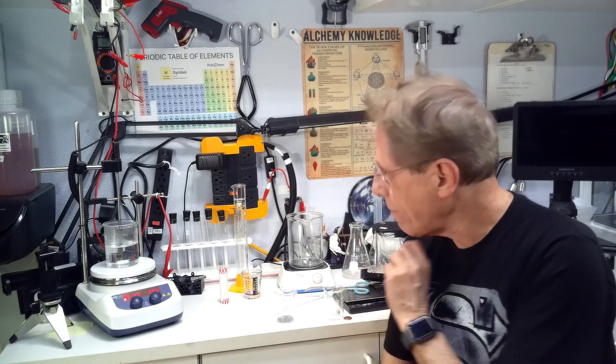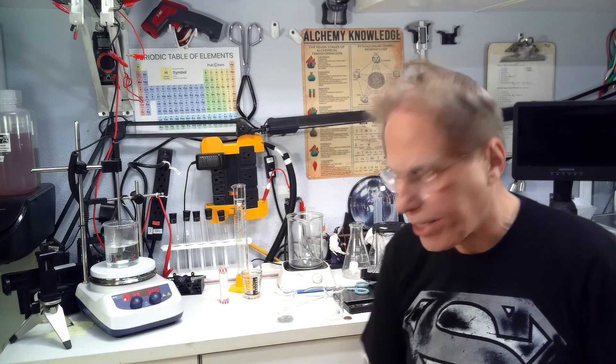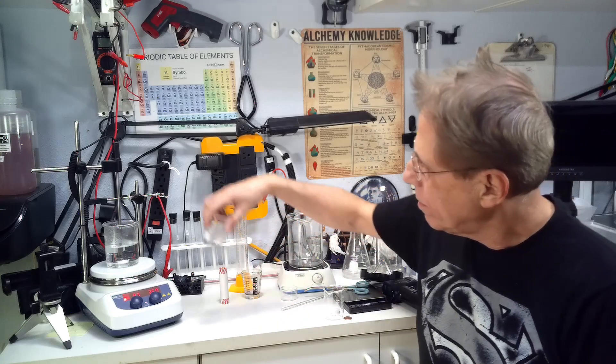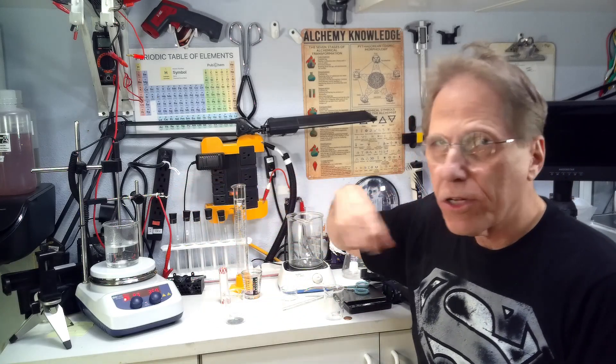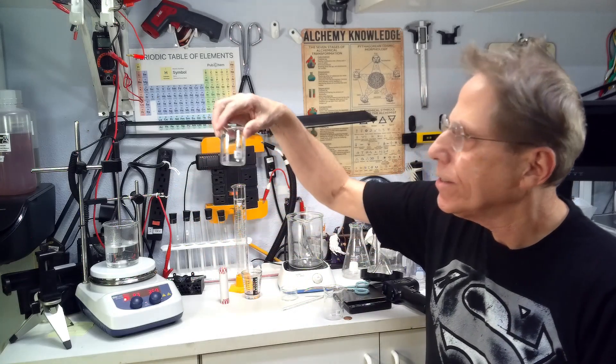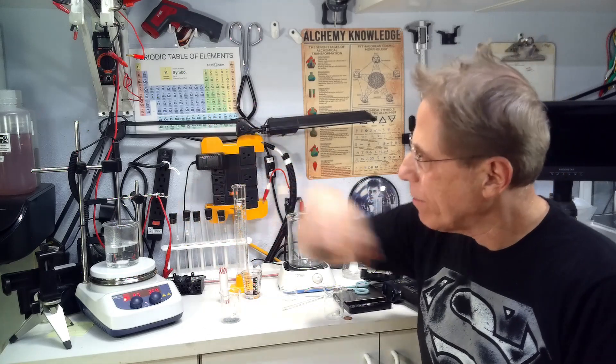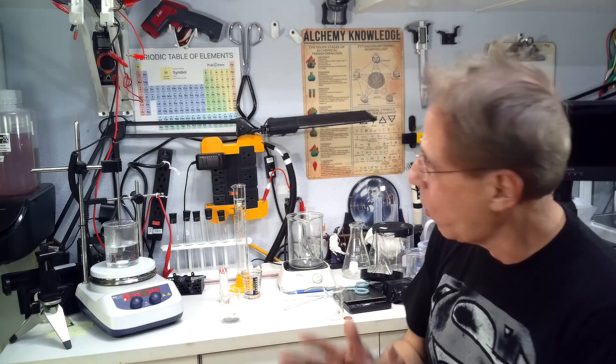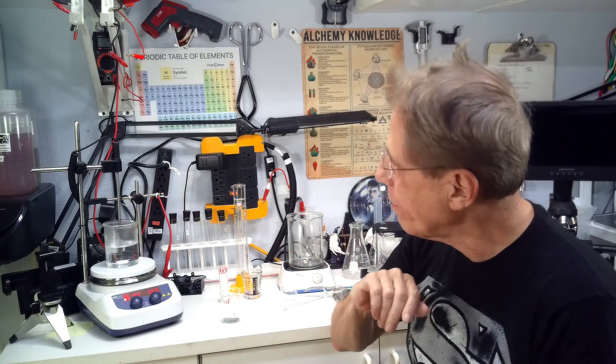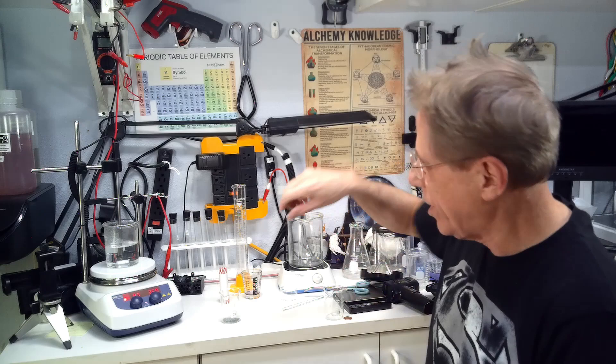With the first step of this process, we're going to take the copper and coat it with zinc. We got zinc and zinc chloride and we're going to add zinc into the bottom of the solution. I'll explain why we do that as we go along. So our water is just about boiling here. It's pretty close to boiling.